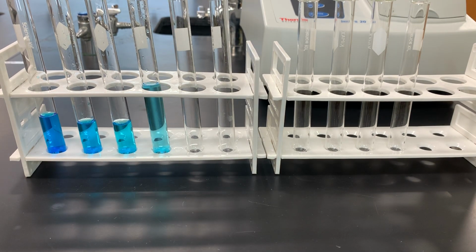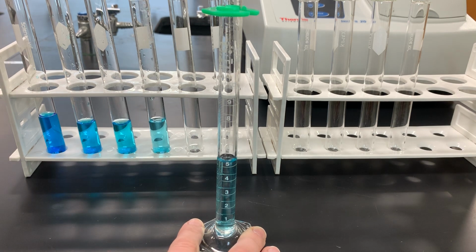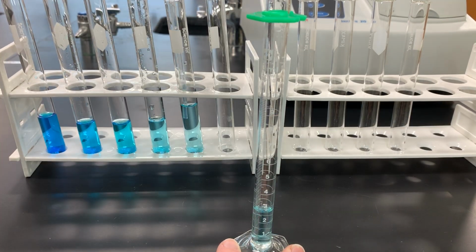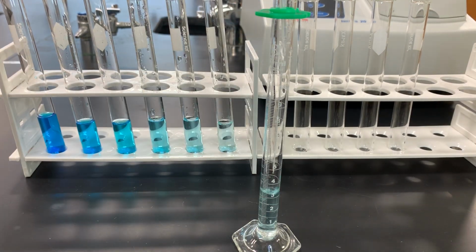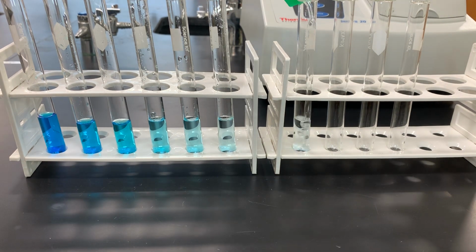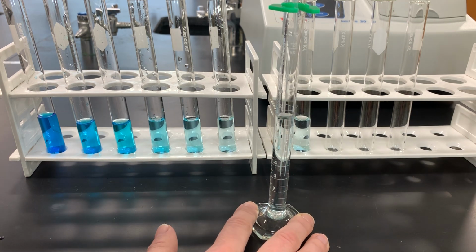Spectroscopy is a way of measuring the amount of light a solution sample absorbs. A beam of light with a known wavelength is passed through a sample. In our lab, we are going to use a red beam of light with a wavelength of 635 nanometers. When we shine the beam of light through our solution, a detector on the other side of the solution measures how much light actually passed through versus being absorbed.